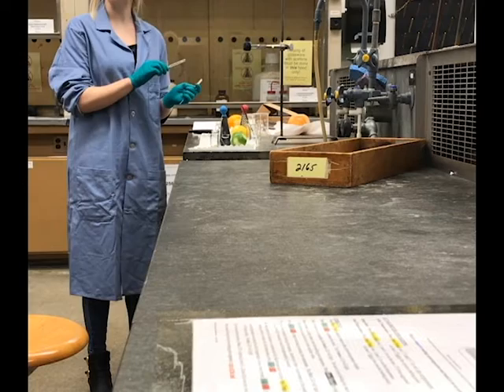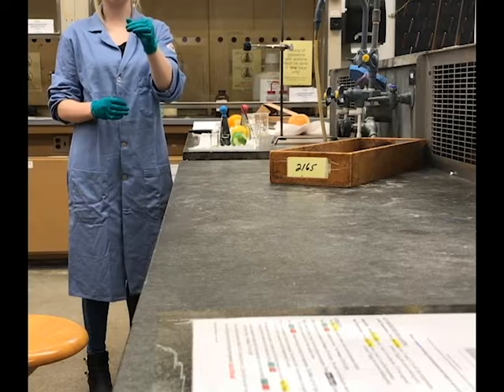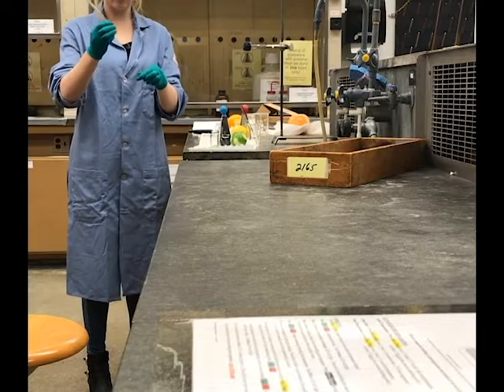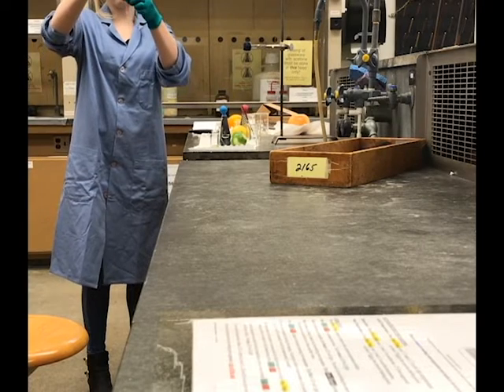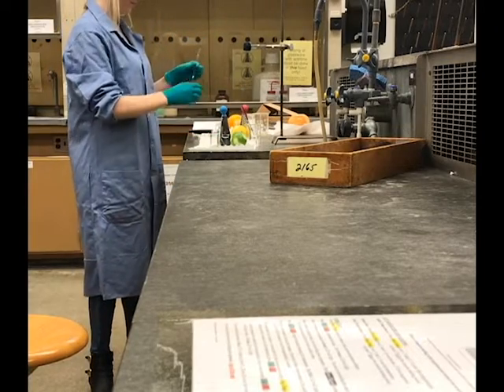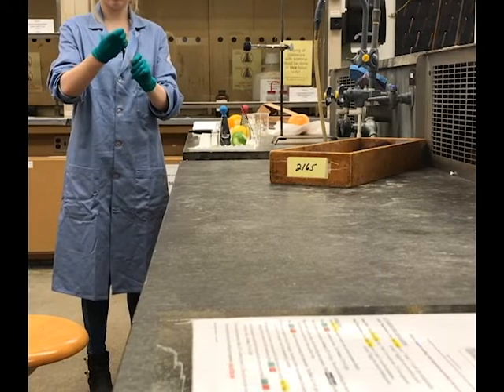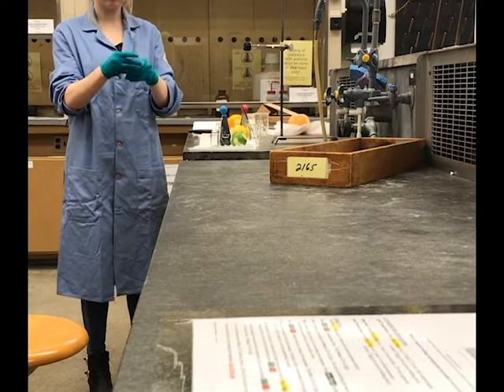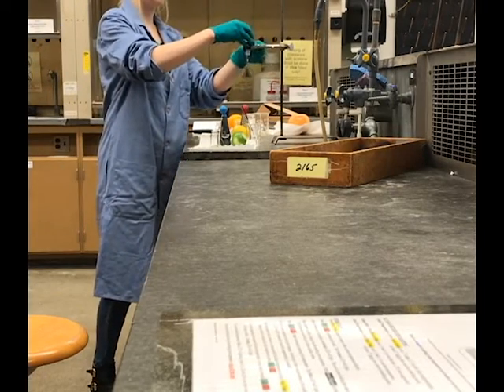Filtering our methanolic suspension of these citrus peels through a cotton plug, which will be going through a Pasteur pipette. So first, we need to plug the cotton down into this narrow part. We will do so with another longer pipette and just stick it there until it settles and doesn't move. From there, we'll place the Tygon tubing, which is slit open, right over the pipette. And then we will clamp it to the ring stand.